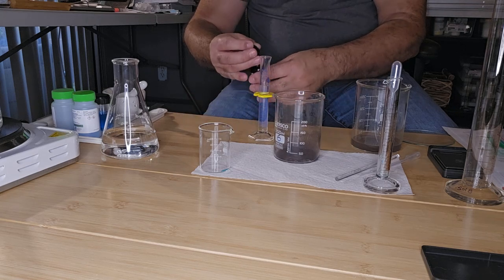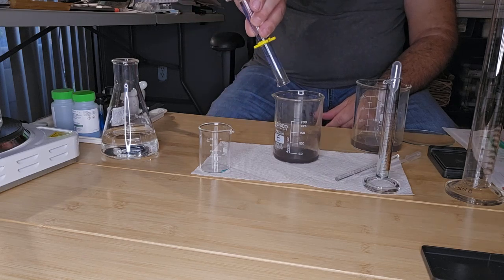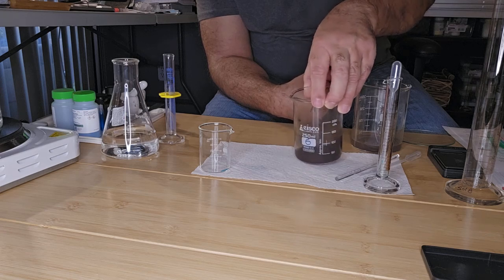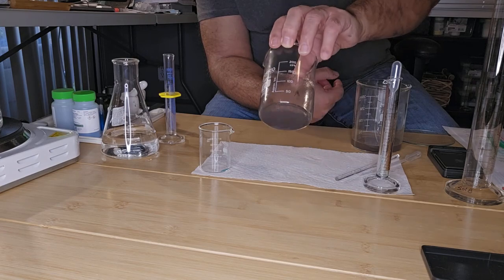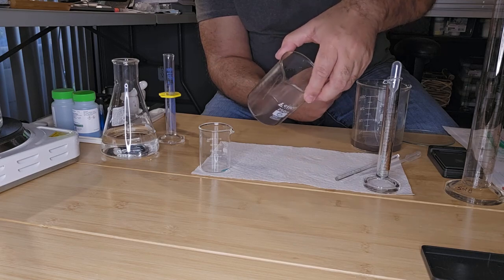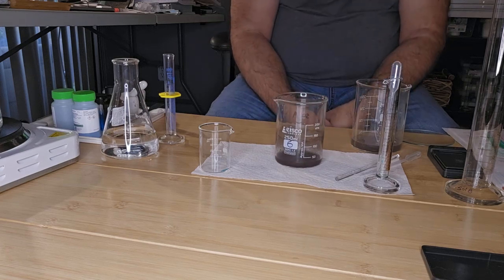Like so. Mix it up again. Let it settle.